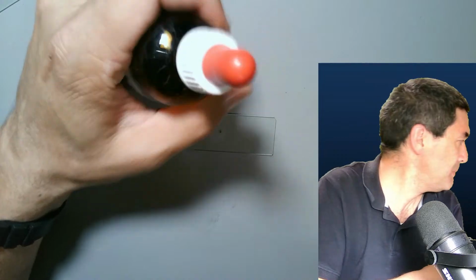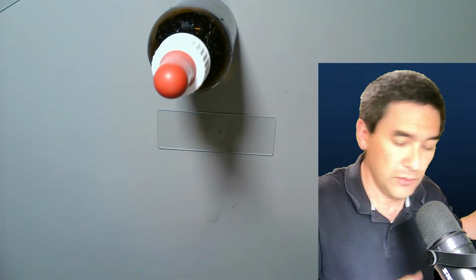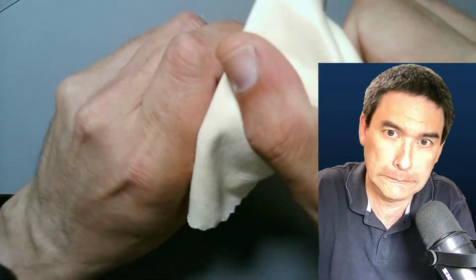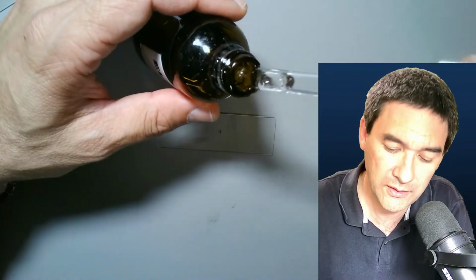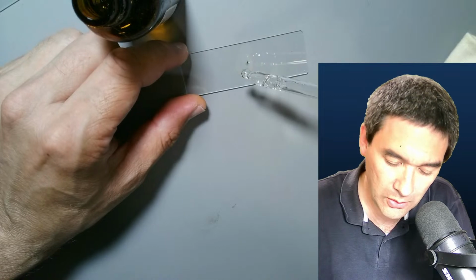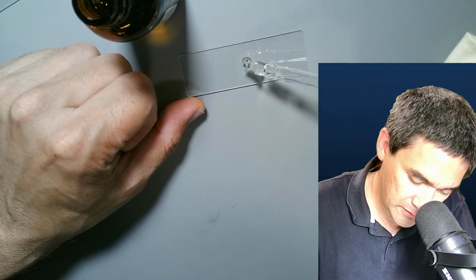See, something unexpected. That's usually always a demonstration effect. But I did not expect this to actually be completely... Okay, here we go. You have to be careful if there's some glue on here. It, of course, glues everything. So let's add a little bit of this water-based mounting medium, the glue, on here.